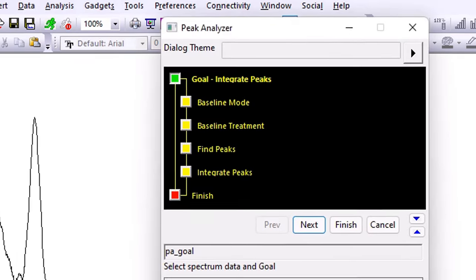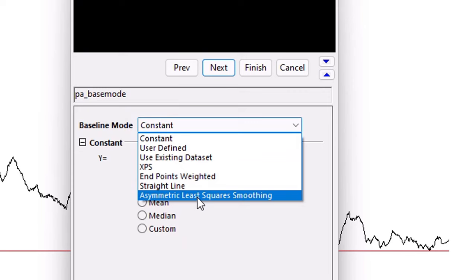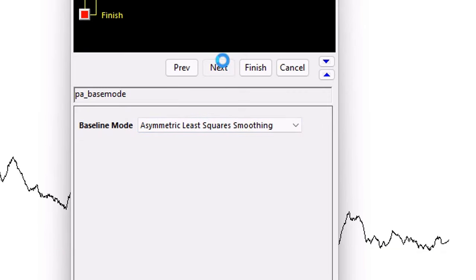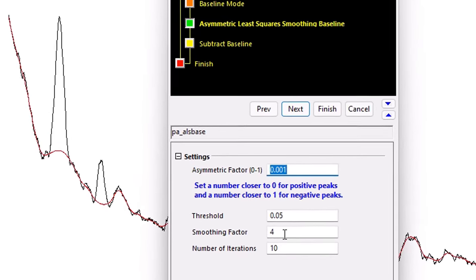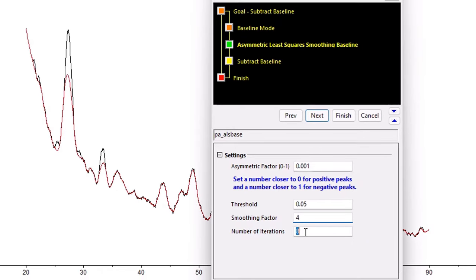Then here, Subtract Baseline, Next. So, this red line will grow. And this is the number of iterations. If I add to this value, then the baseline will appear. I originally chose 4 and 10. You can go lower than this number of iterations.